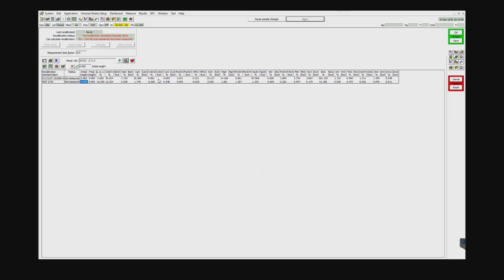Another thing you want to be cautious of is in the application calibration itself, if you excluded points, they will show up here in whatever curve that you were looking at. So let's say, for example, if you excluded calcium, this sample from the standards, and you included a standard in the recal samples here on this table, it would show an X, which means if there's an X here, exclude, it's not going to use this measurement to do calcium oxide correction, okay?